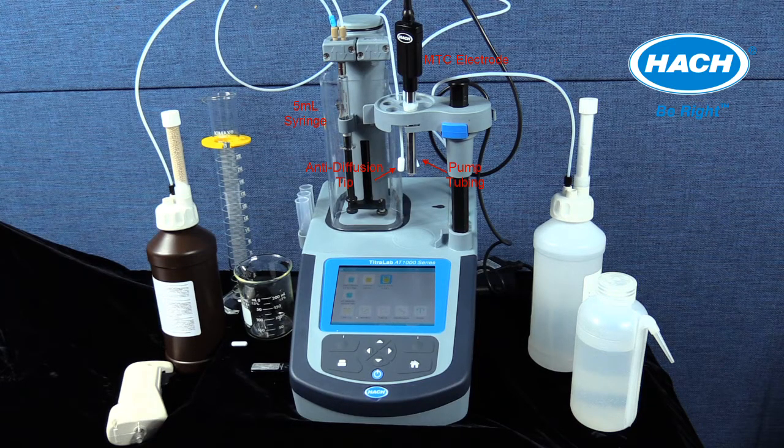Chlorine electrode MTC 695 has been connected to the titrator in the back of the instrument in sensor port 1 and placed in the sensor holder using the electrode sleeve received in the application pack. The following items have been prepared for use, including the potassium iodide swift test, a clean glass graduated cylinder and beaker, a stir bar from the application pack, wash bottle filled with deionized water, a waste container, and a sample to measure.